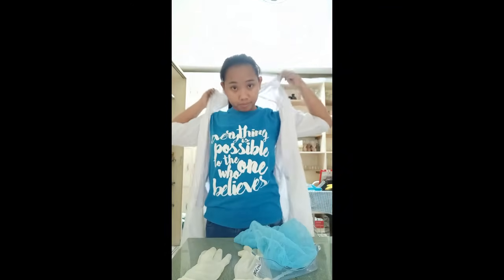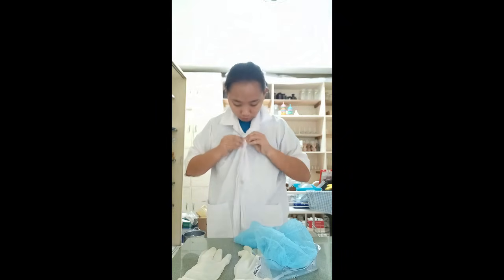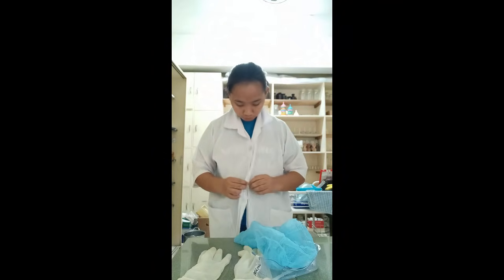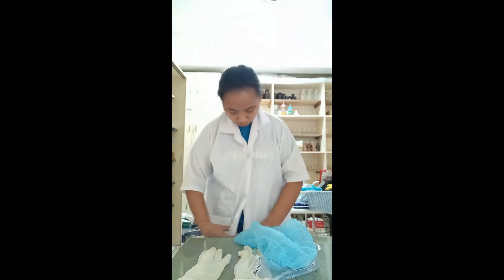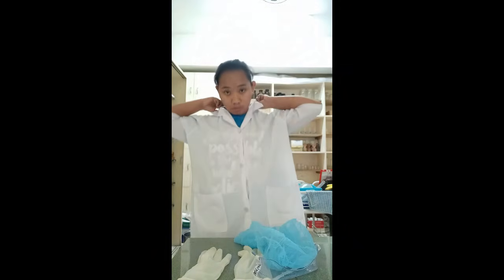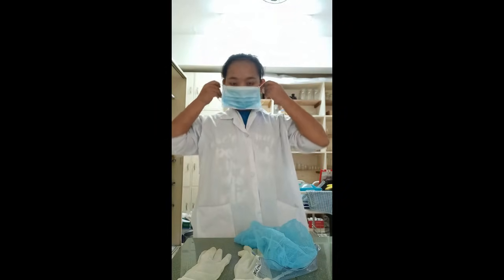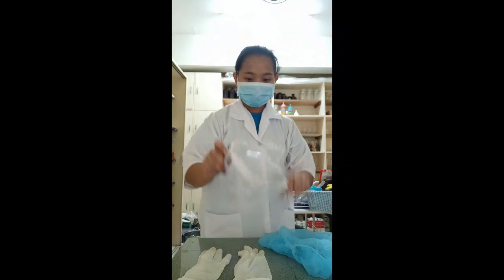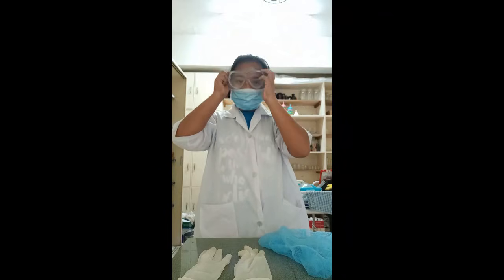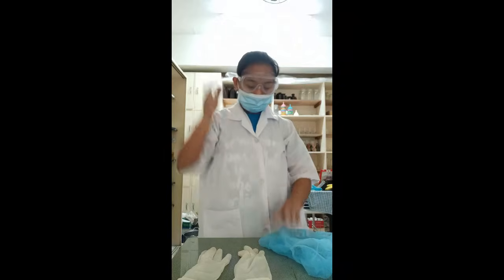A laboratory coat should be worn and buttoned whenever chemicals or biological materials are handled. It will protect the wearer's personal clothing and exposed skin from contaminants. Eye and face protection is extremely important when working in a laboratory and must be worn if a hazard exists that could cause eye or face injury. Safety glasses and goggles provide protection against impact hazards.